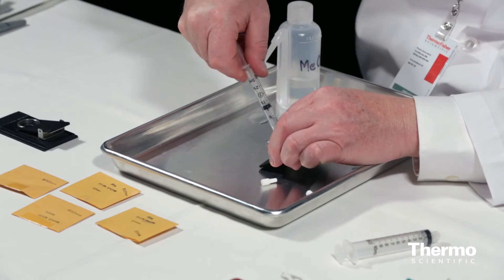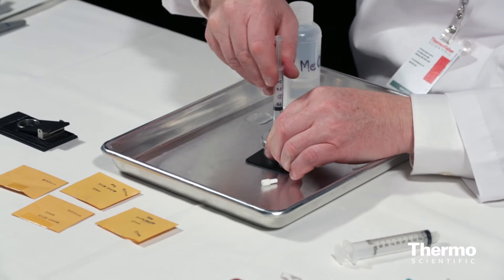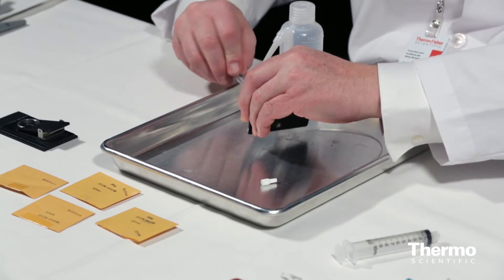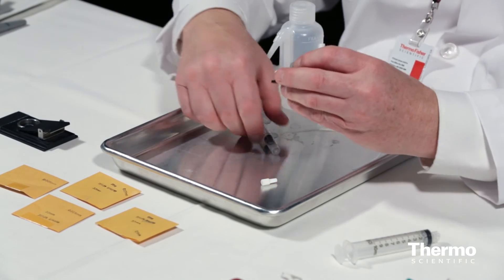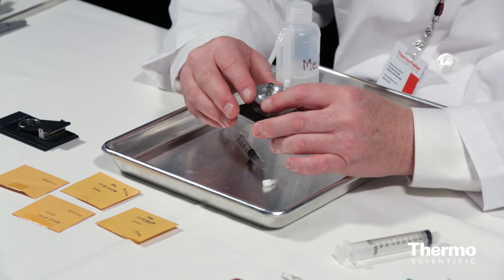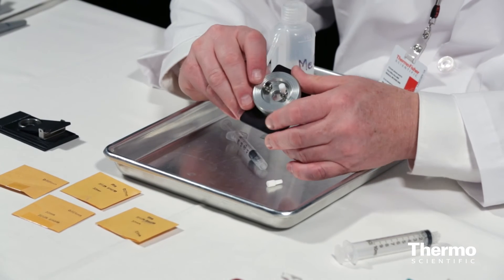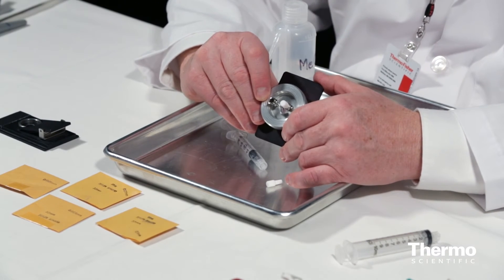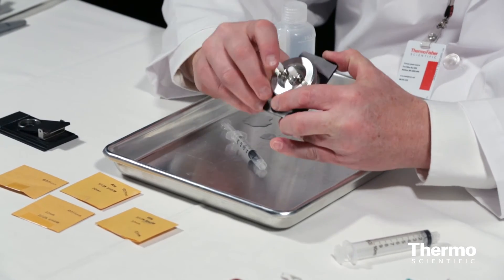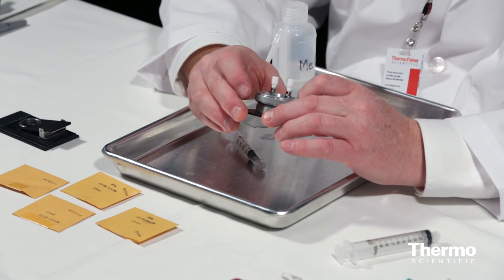As liquid rises through the other fill port I know the cell is filled. Before removing the syringe I put on one of the sealing caps. When I remove the syringe port I get a little squirt of methanol — just a small droplet. Now the cell is filled, and I'll put on the other cap. The cell is ready to take over to the lab and use in the spectrometer.